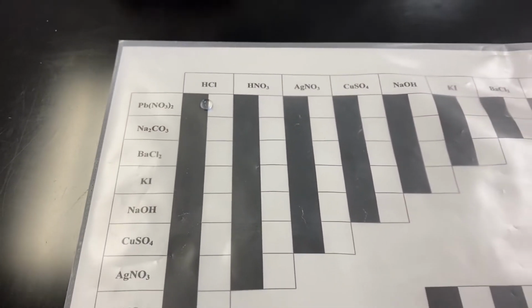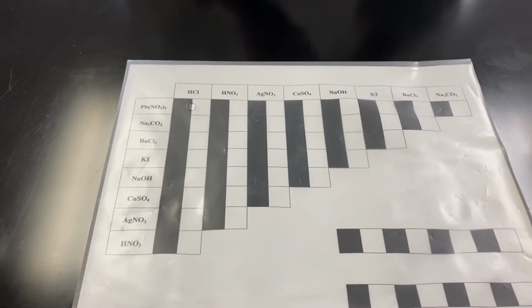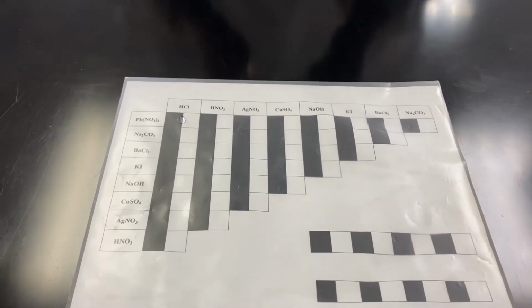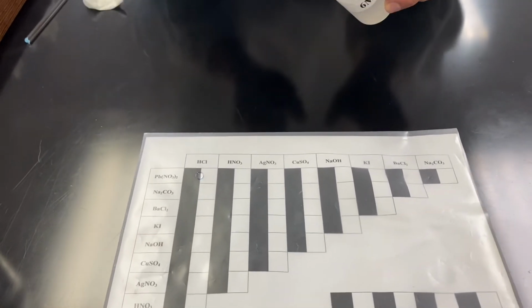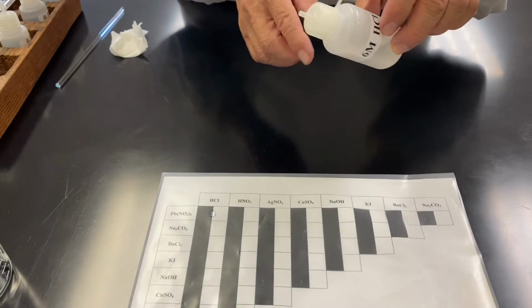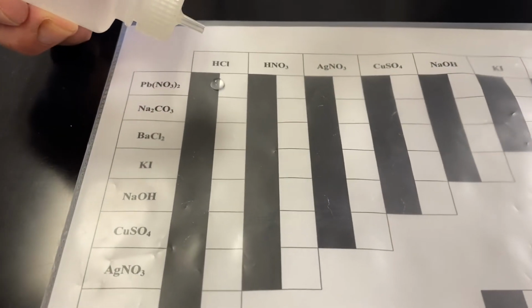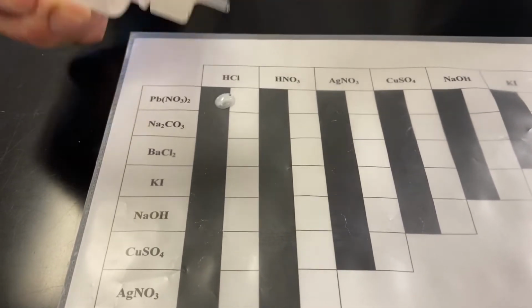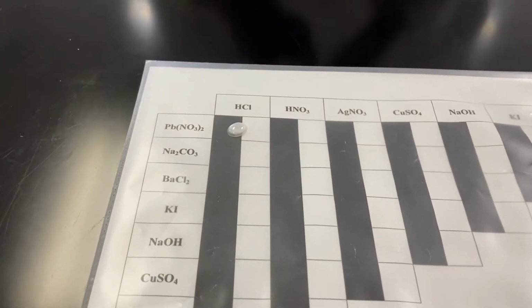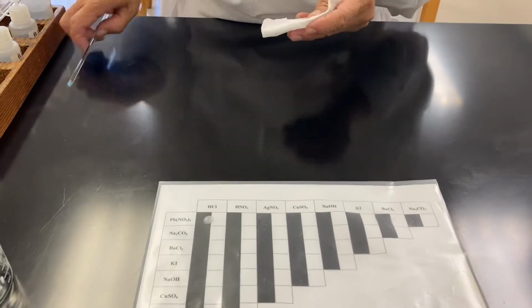All right. Now the second drop, which is HCl. It's very crucial, because all of you need to understand that you should not contaminate your reagent bottle. So that drop should be directly added to the top of it. You will see immediately a white PPT being generated.